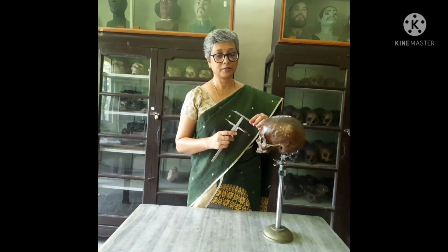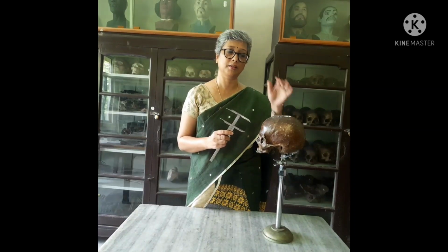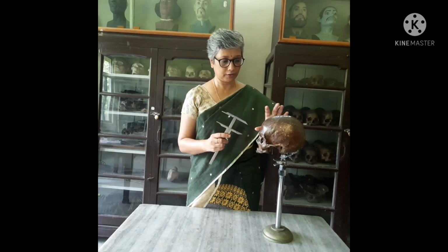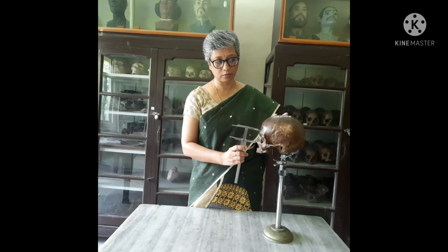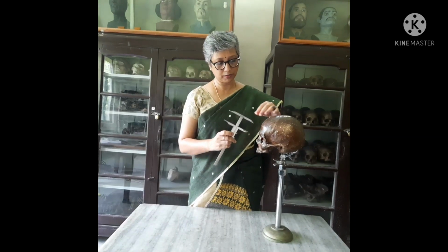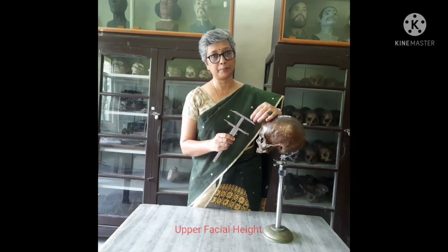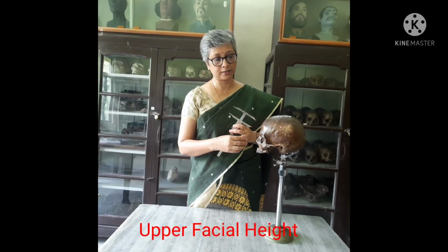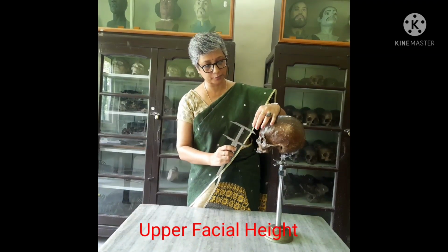So this time we'll take a height measurement. There are different height measurements that we can take on the facial region, like the upper facial height, nasal height, orbital height. So we will start by showing how to take the upper facial height. The landmarks used for the upper facial height are the nasion and the prosthion.